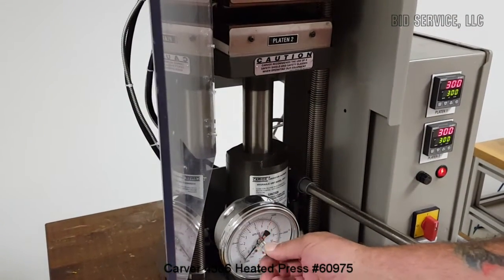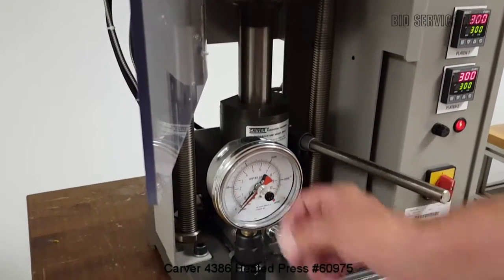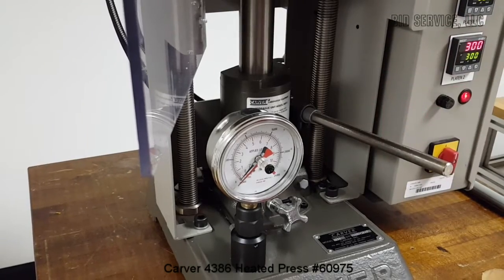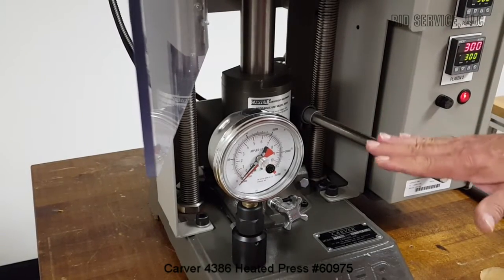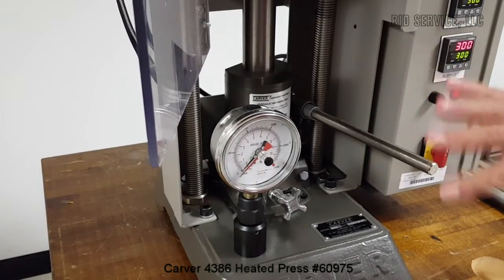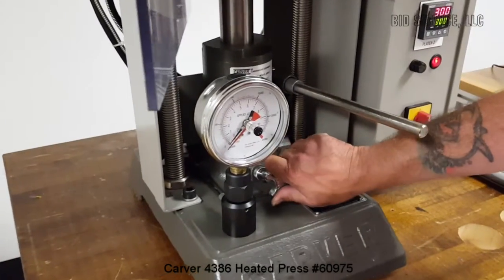The red adjustment here lets you set the pressure you want as you pump. Make sure it stays there. According to the factory, it takes a couple of pumps to get it stable, and then it will hold with no problem.